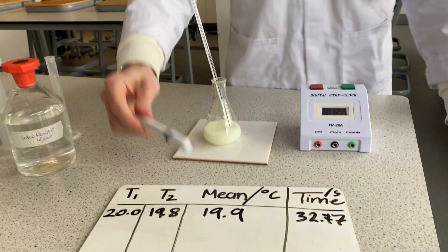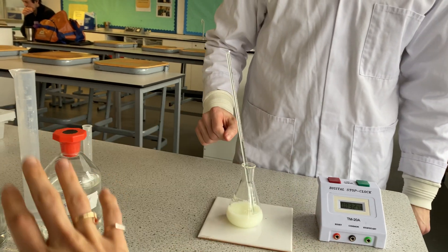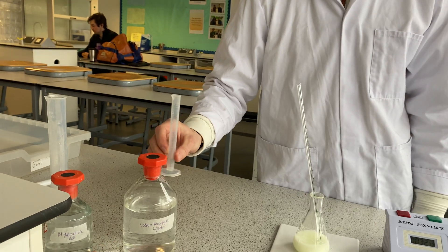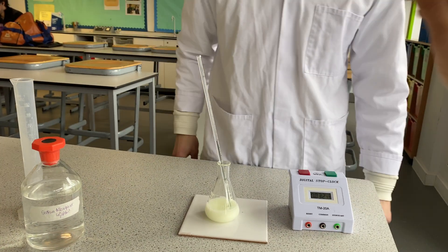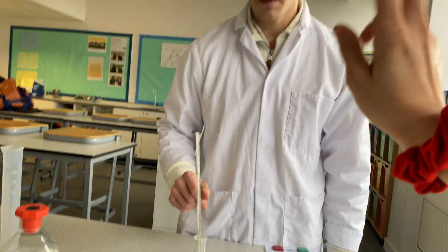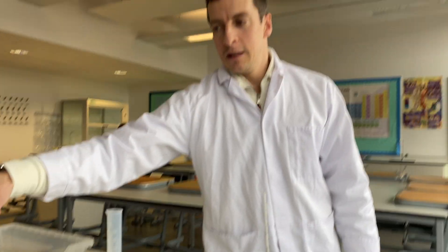We're done with this temperature, having done the reaction at 19.9°C. Now we need to repeat the same reaction at different temperatures. To consolidate: we added 50 cm³ sodium thiosulfate to the conical flask, then added the hydrochloric acid from a separate measuring cylinder for accuracy, started timing immediately, and stopped the timer when we could no longer see the cross. We then re-measured the temperature and found the mean.